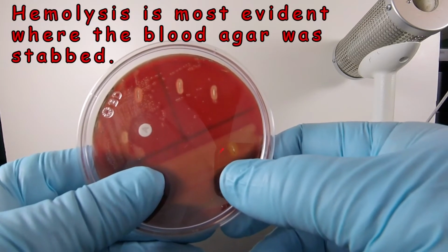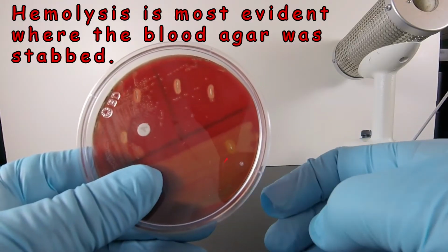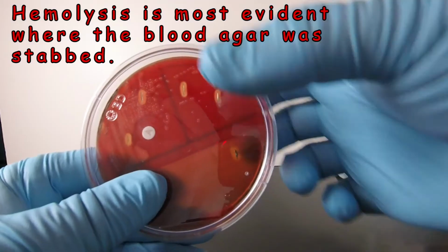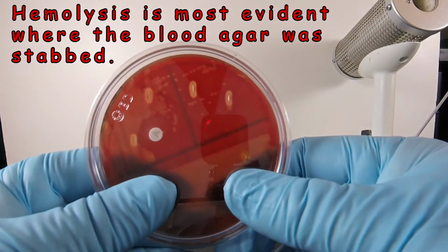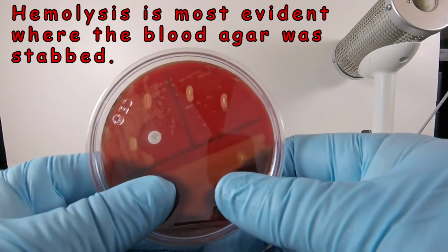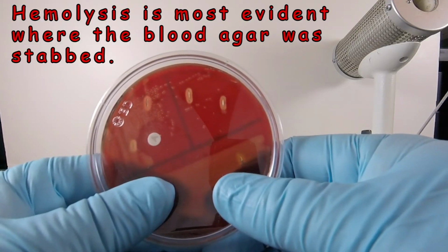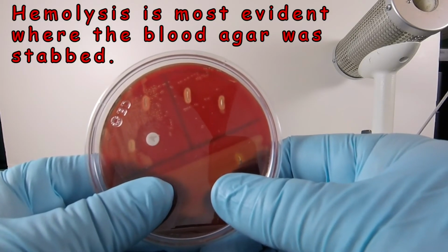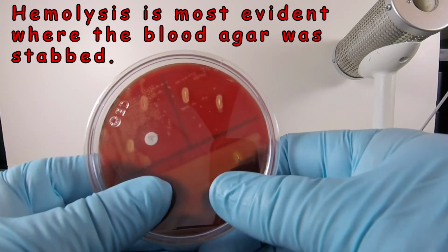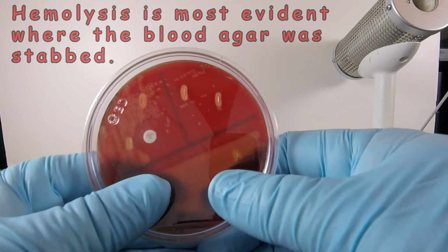Now, the reason we stab blood agar is so we see more hemolysis faster. So notice where the agar was stabbed, we can see complete hemolysis overnight. Both the hemolysins that are inactivated by oxygen and those that are not inactivated by oxygen are functioning when you stab the agar, and so you see more hemolysis faster.